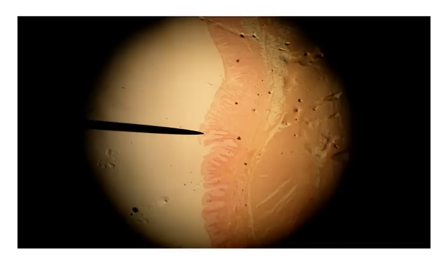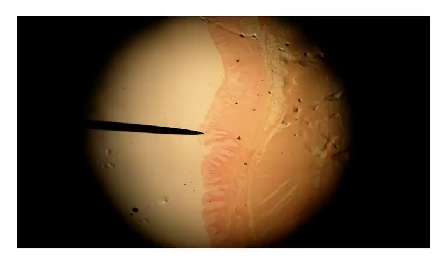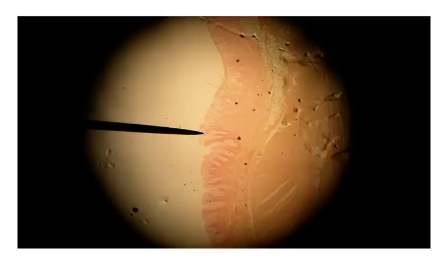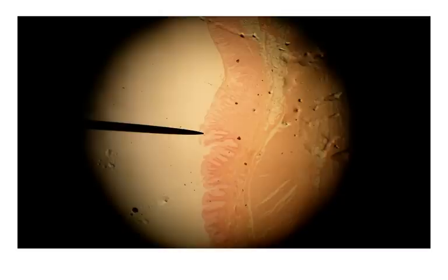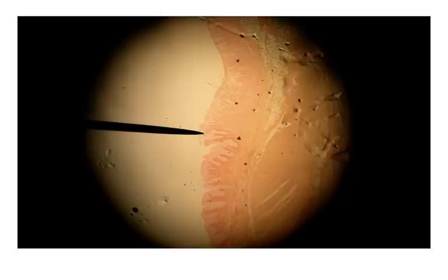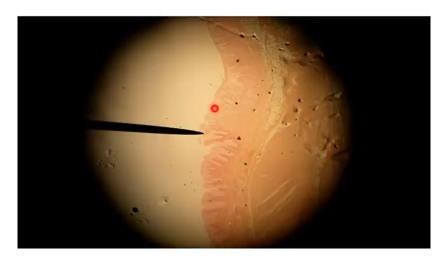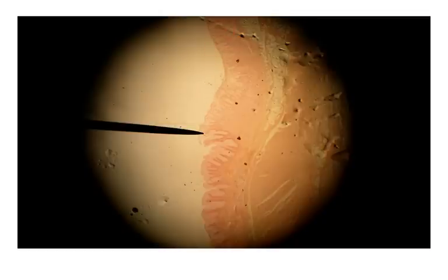Now let's move on to the digestive system. This slide is one that really trips a lot of students up — this is the gastroesophageal junction, where the esophagus and the stomach meet. In this view it's really difficult to distinguish what you're looking at, so on the next couple of slides we're going to look at each area at higher magnification.